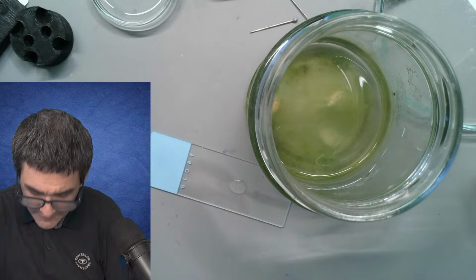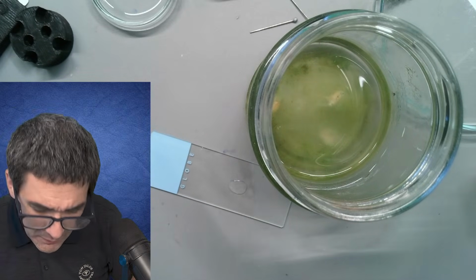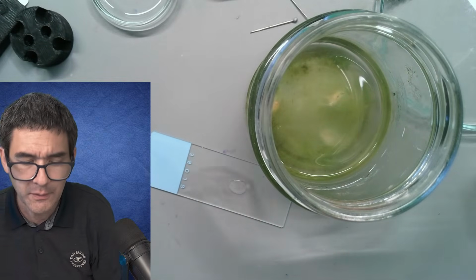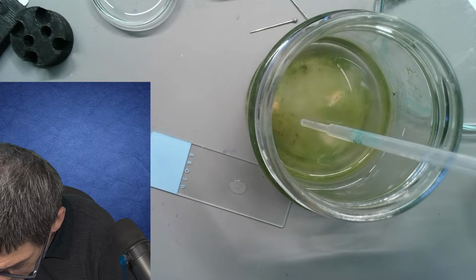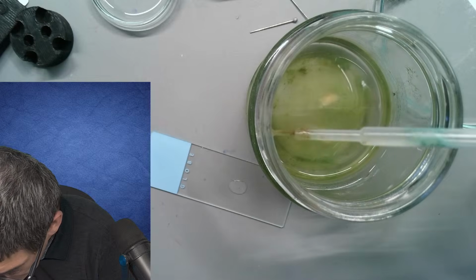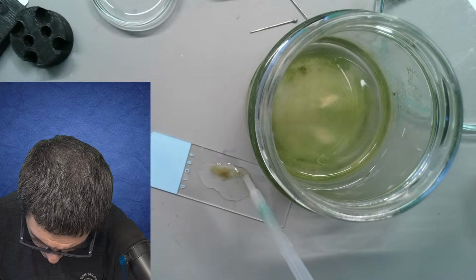I mean, there will be already plenty of stuff in here, but I was actually hoping maybe. What I'm going to do now is the following. I'm going to take a slightly larger pipette, and I'm going to take a slightly larger sample. This is pretty disgusting, and that's nice. Ooh, it is too much. Way too much.